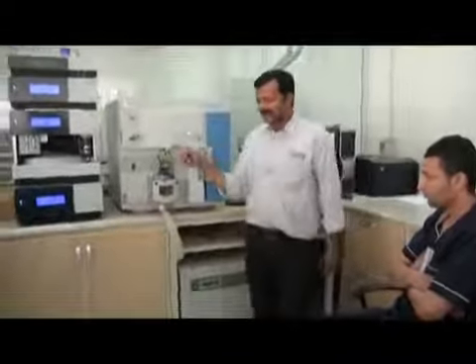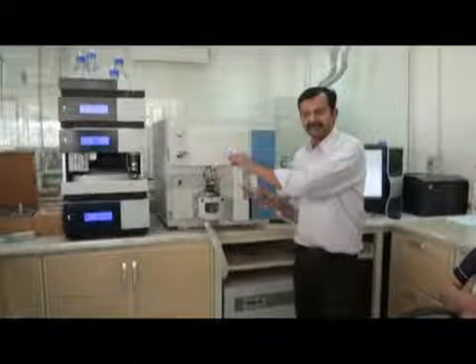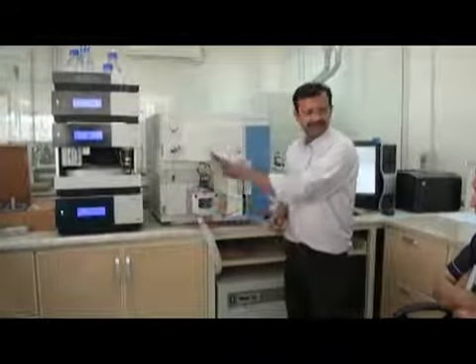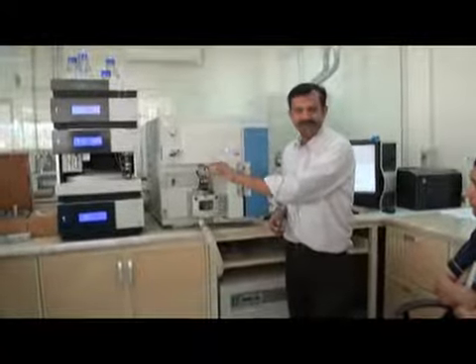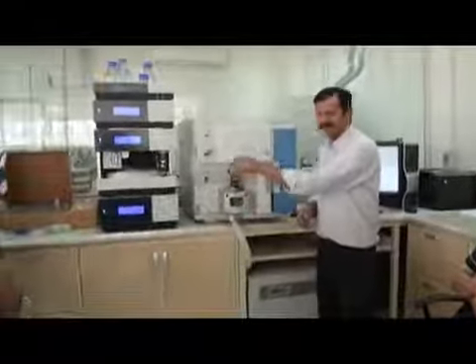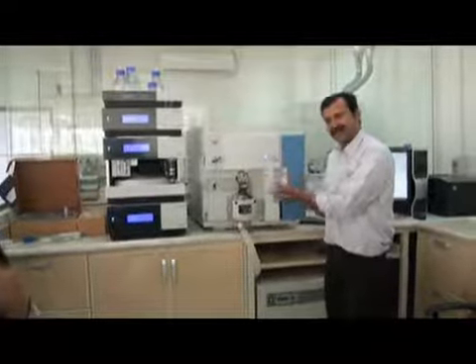So this part is clear. Don't get upset and don't get worried about the high voltage. It has very, very good safety features. If you open this, HV will be off. High voltage we call it HV. If you remove this, it will be off. So we have a good safety feature here. Don't worry about it. But this is the way it works.